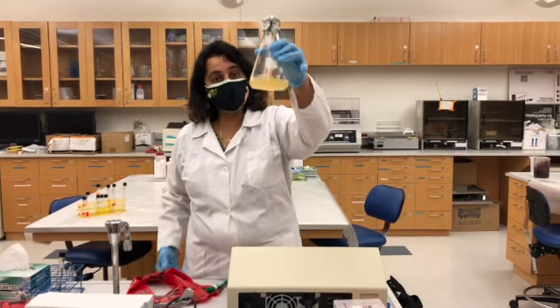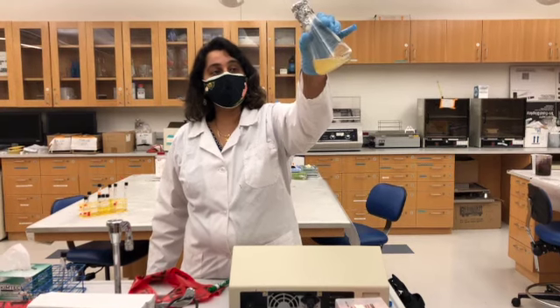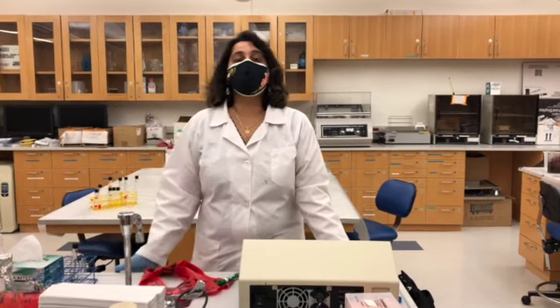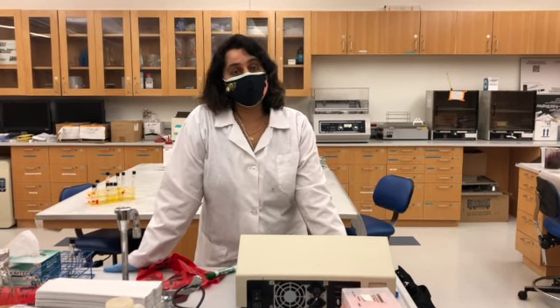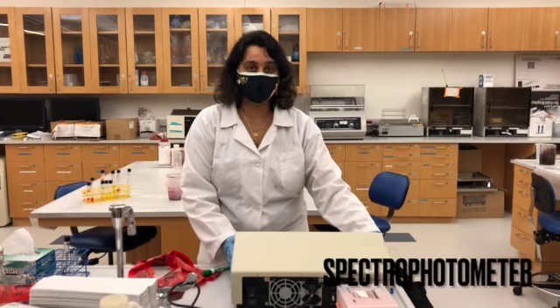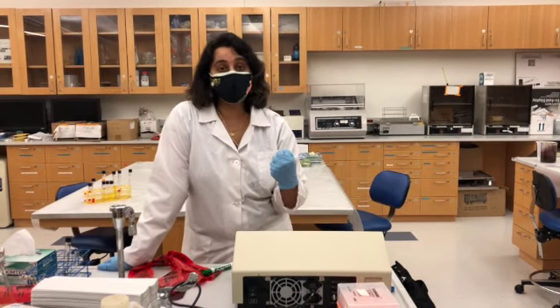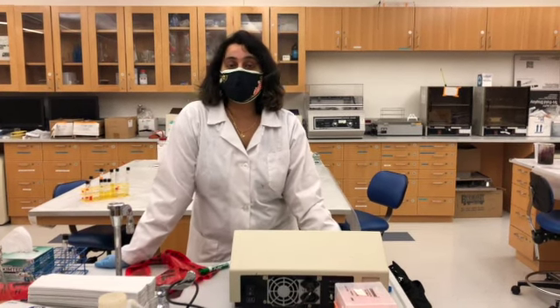The bacterial cells will reproduce, they will double up every 20 minutes, and you can see that the culture becomes cloudy. Through these 4 to 5 hours, every 60 minutes, we can collect samples from the bacteria and track the growth of the bacteria. So how do you track the growth of the bacteria? We use a spectrophotometer. A spectrophotometer is a machine that uses a source of light, and the absorbance of that light by the bacteria is an indication of the bacterial growth.